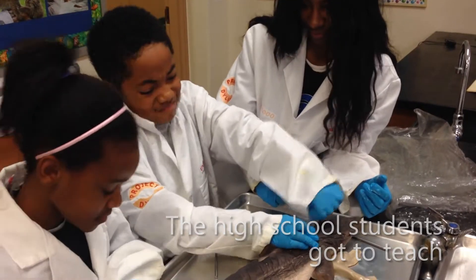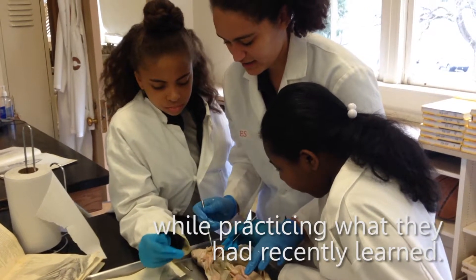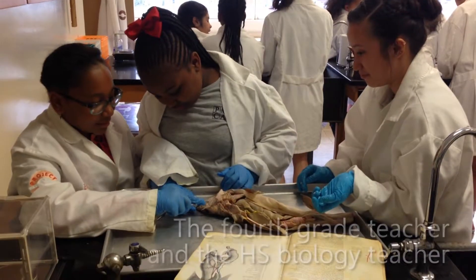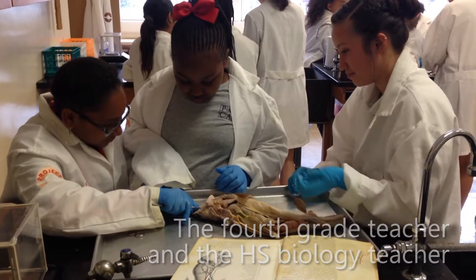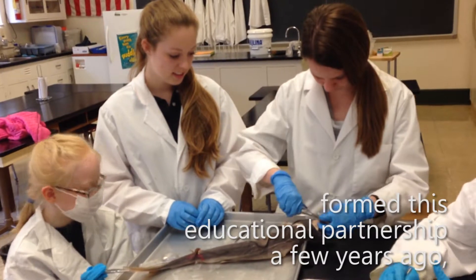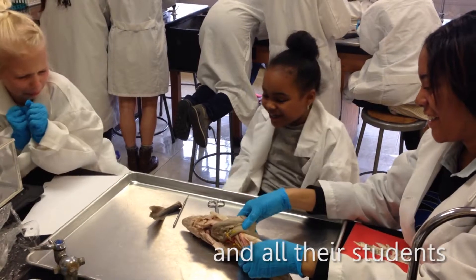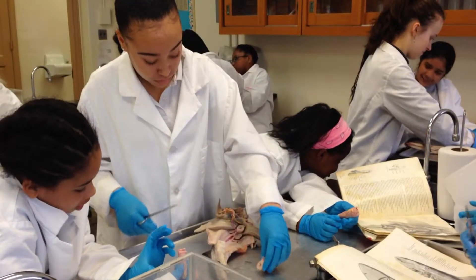I just cut off. Yeah, it has the atrium and the ventricle. Why are you touching? So we have to reach on this one. Are there any of them that's not in there? You can see that.